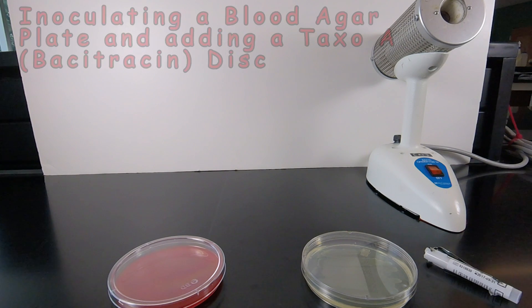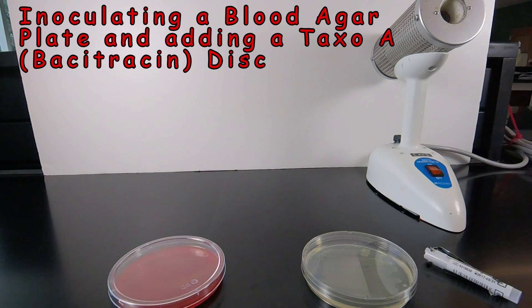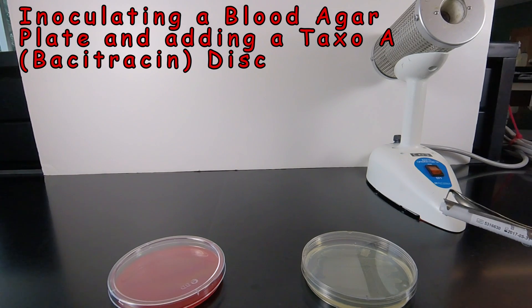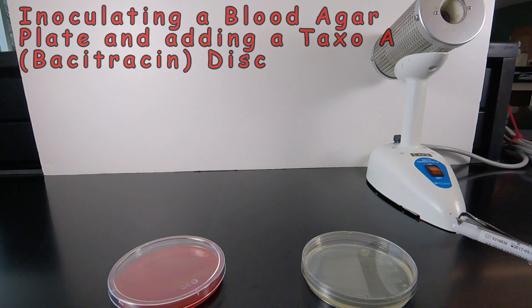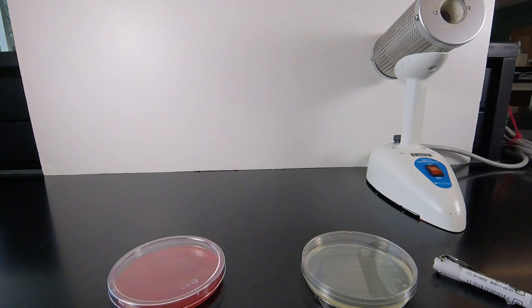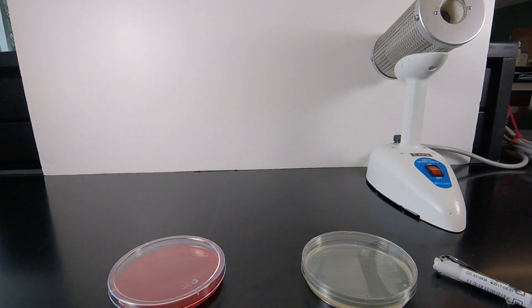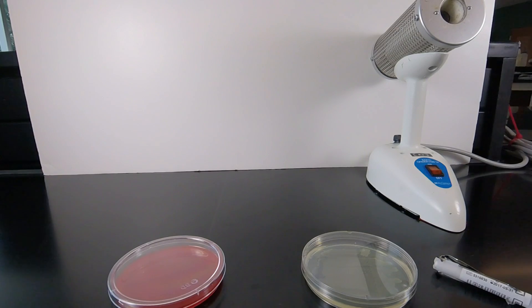In this video lesson we're going to learn how to streak a blood agar plate and place a Taxo A disk containing the antibiotic bacitracin on the plate. This is the classic test for identifying Streptococcus pyogenes, the bacterium that causes strep throat.